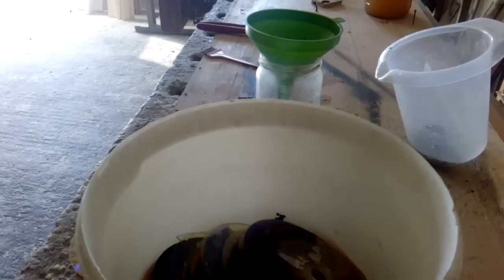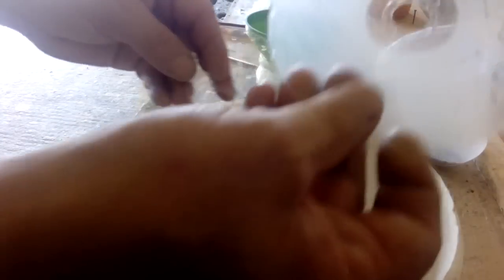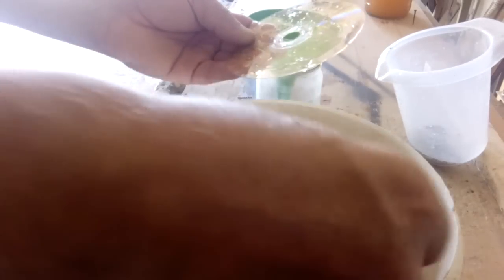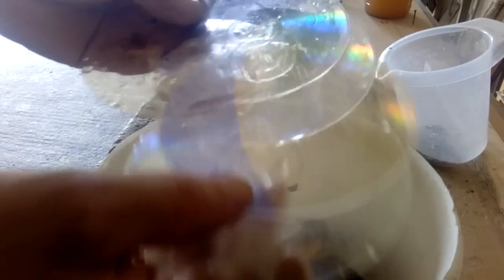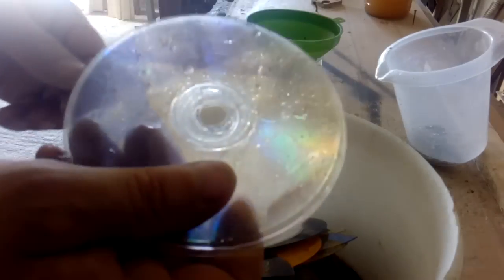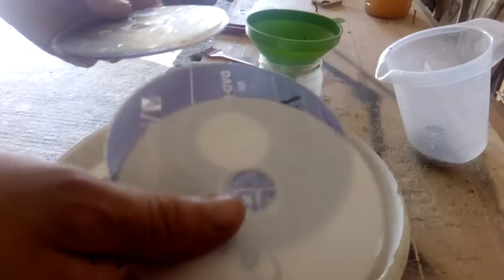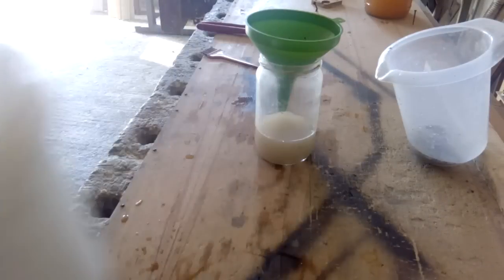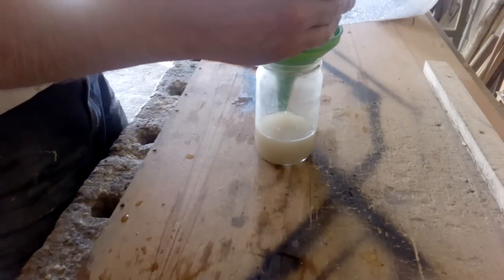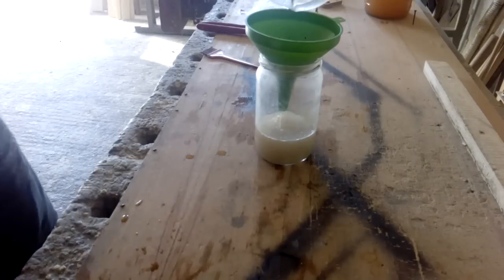We'll leave those for another time. And here in this pile we got some cool discs which are clean. I see this one actually has a number but it's clean. I got a couple of these discs which are actually pretty cool - already clean. So I will not drop that in the garbage. I'll actually make some sun catchers. But I need a separated disc, and the other discs will go in the plastic waste. So we are going to filter that again.